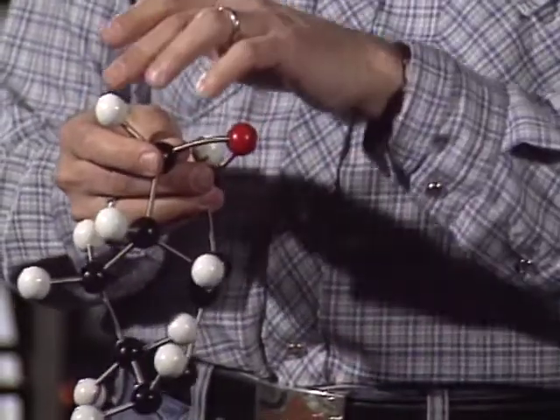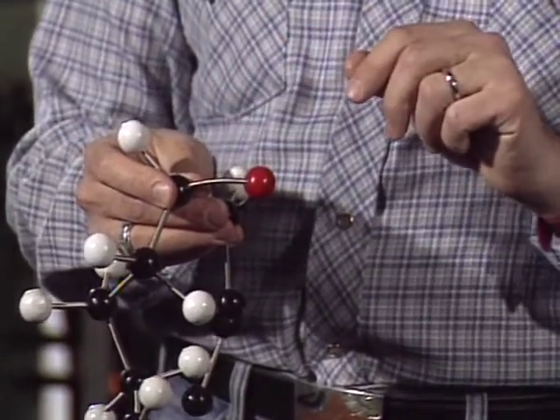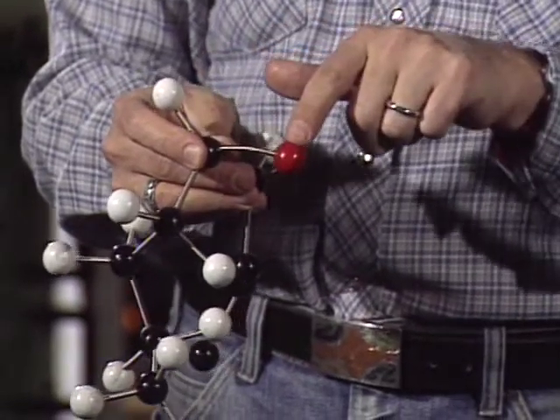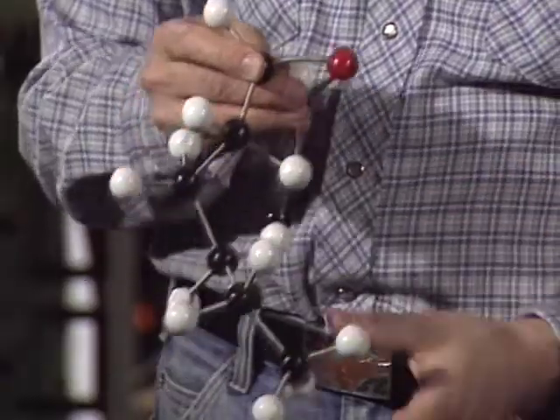Often, the situation is not like that. The molecule that's made in a laboratory was never there before, or it's been isolated from a biological organism for the first time. Still, we can use spectroscopy to get its structure. From one spectroscopic technique, we get that there is a CH bond and a CO bond. From another technique, we find that this hydrogen is attached to a carbon that has an oxygen, but there are other hydrogens which are attached to carbons that don't have an oxygen. Slowly, we piece together the structure of the molecule.